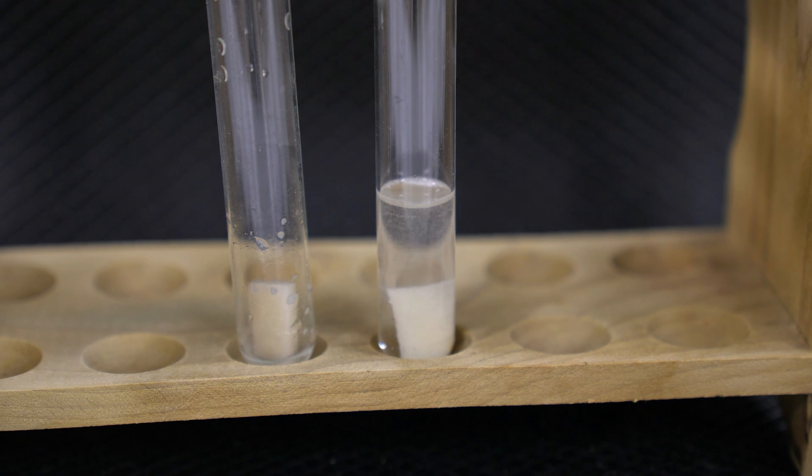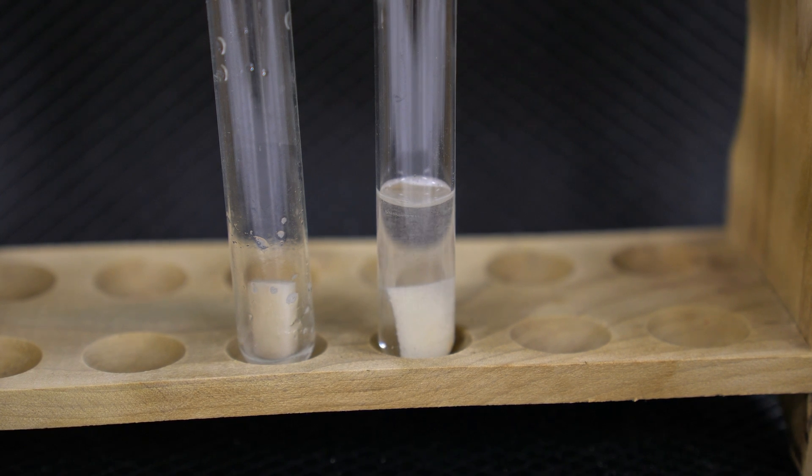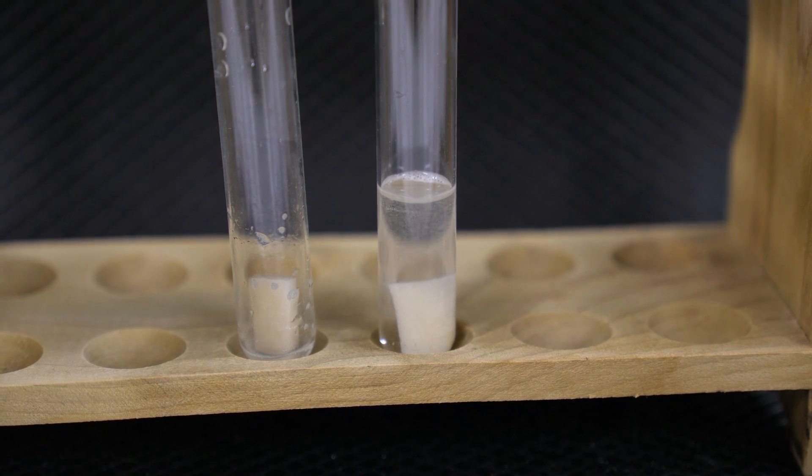So important to keep in mind the variability we have here. The catalase enzyme is at the same concentration, but the reactants aren't fully there. We've reacted a lot of the hydrogen peroxide away. While there is still some left, overall, that reaction is greatly reduced from what we saw before.